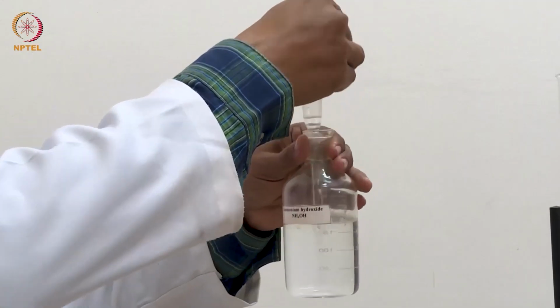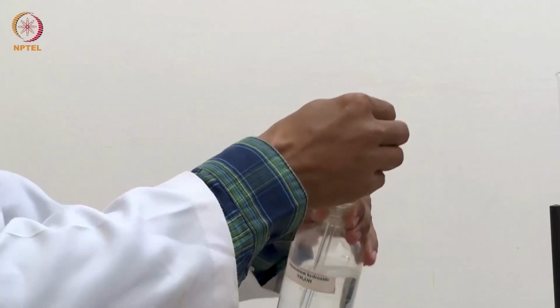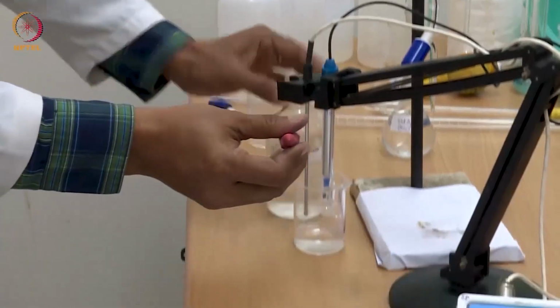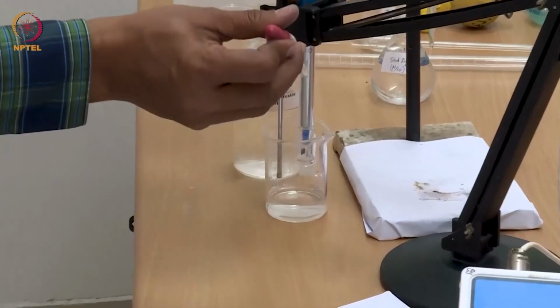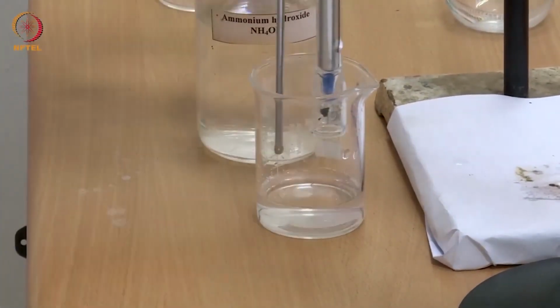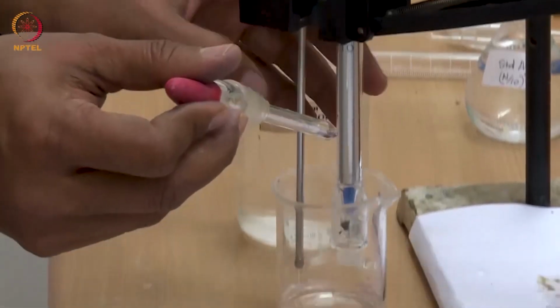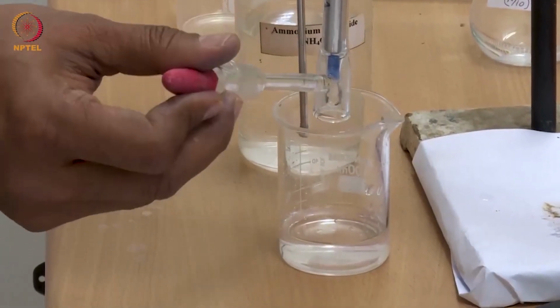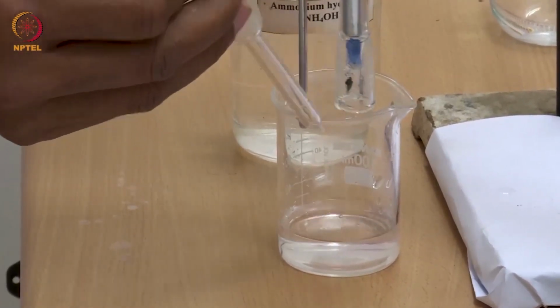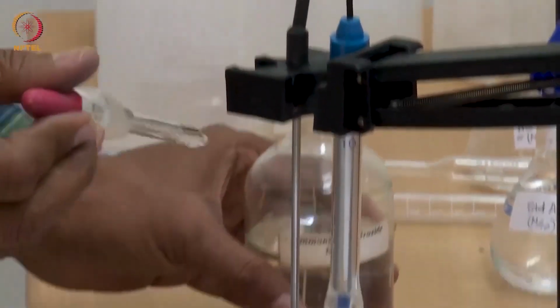it will remove it from the electrode. We should be careful while using ammonium hydroxide. We should not smell it, as you know it has a pungent smell. We are using a very dilute solution of ammonium hydroxide to dissolve any precipitate that may be sticking to the wall of the electrode. We should clean the electrode surface as well 2 to 3 times with this ammonia solution.